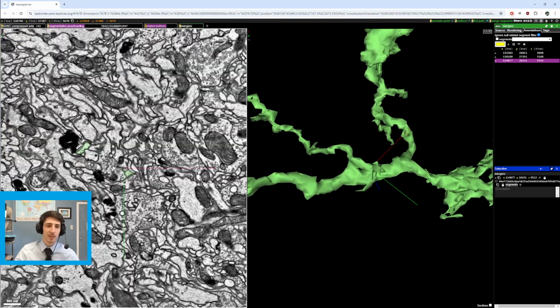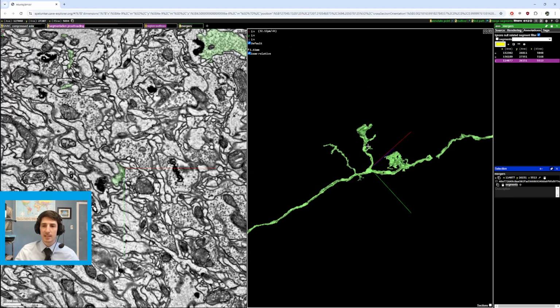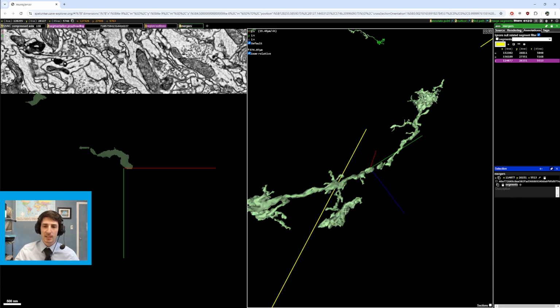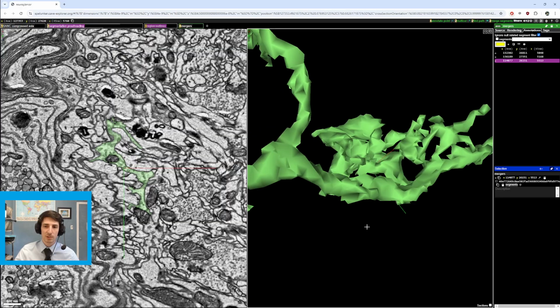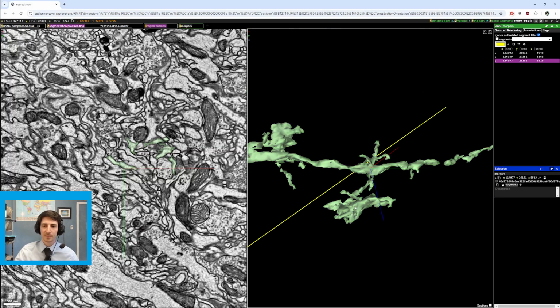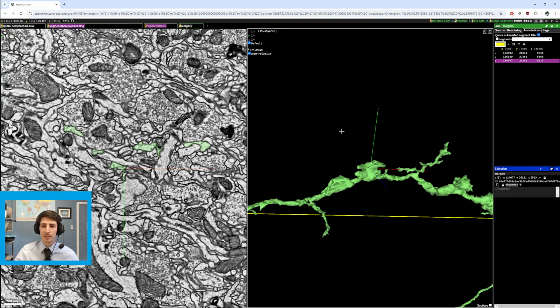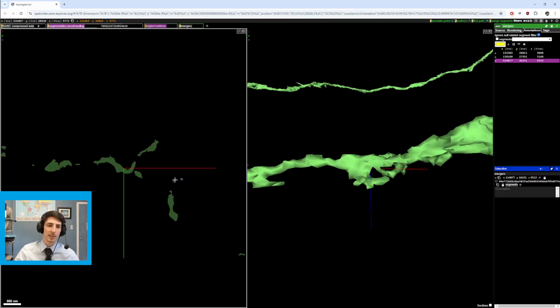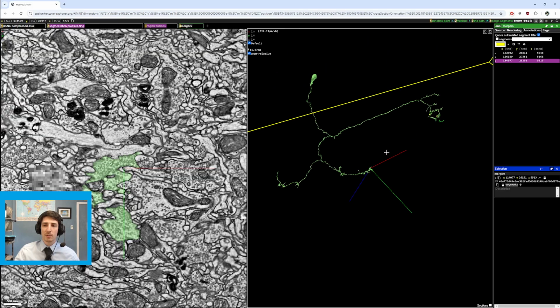Well, sometimes you just have to double check to see if it is or it isn't. This isn't as perpendicular, and you'd expect a branch like this, so that seems fine. This is clearly a merger to me. When it's thin like this and then it turns into a large structure that is very dissimilar than this branch, that would be a merger as well. These are smaller mergers, but as I said, they can add up, and sometimes these clues will lead you to much bigger mergers, right? So we check that part.